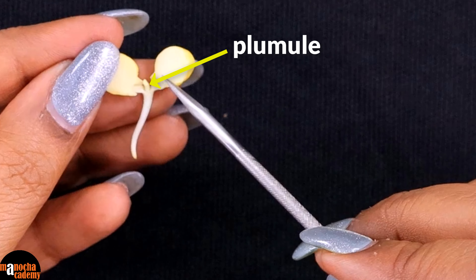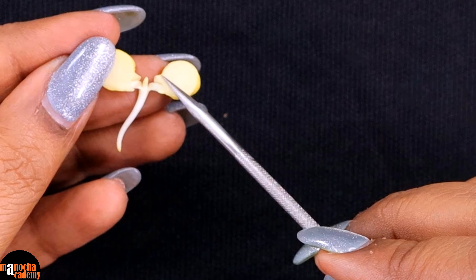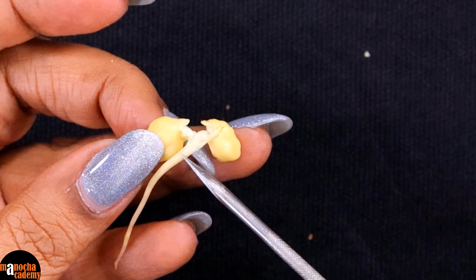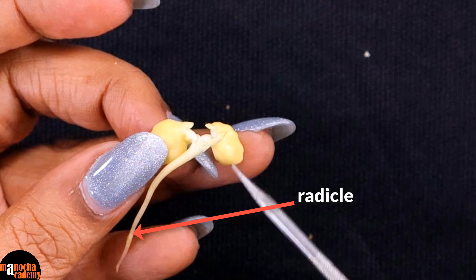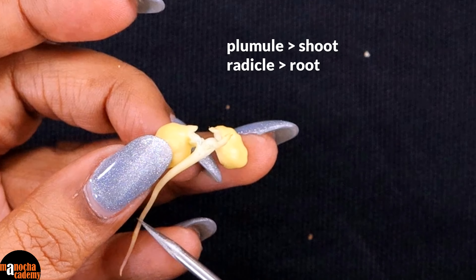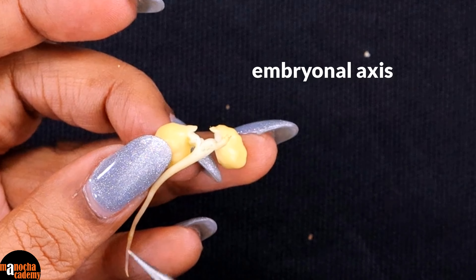This entire thing is the embryonal axis. This is the plumule, this is the epicotyl, this lower part is the hypocotyl, and this is the radicle. The plumule will give rise to the shoot, the radicle will give rise to the root, and this is known as the embryonal axis.